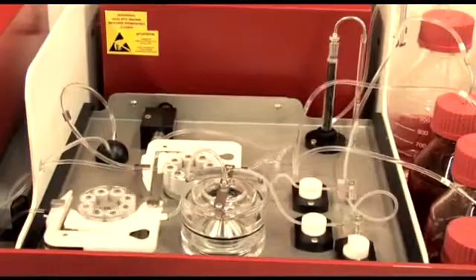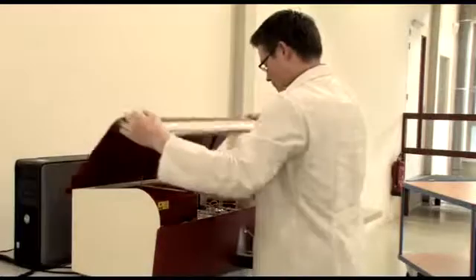The cleaning process takes several minutes. After this, the instrument is ready to go.